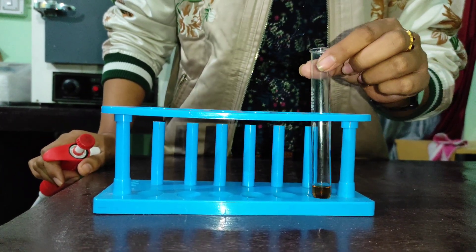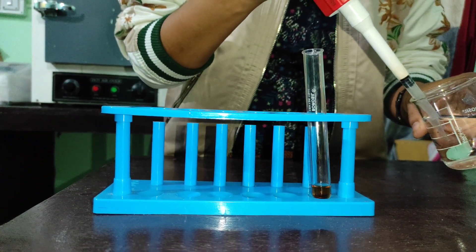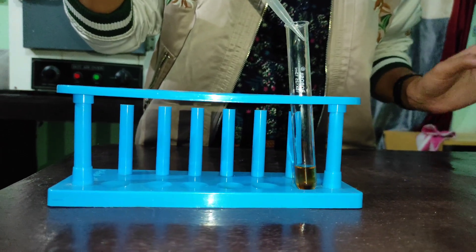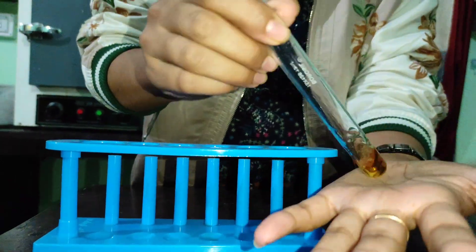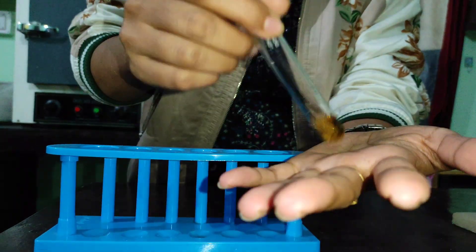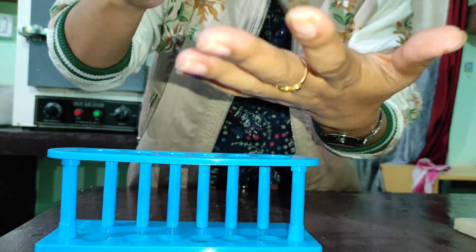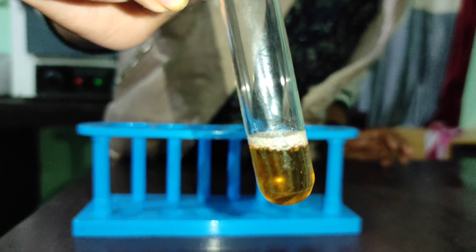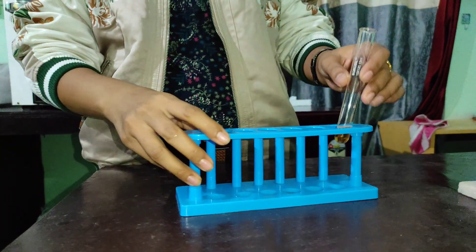Now we have the last extract. Here I am adding one ml of distilled water. You can choose your solvent according to your choice of work. See the froth? This indicates the presence of saponin — a positive result.